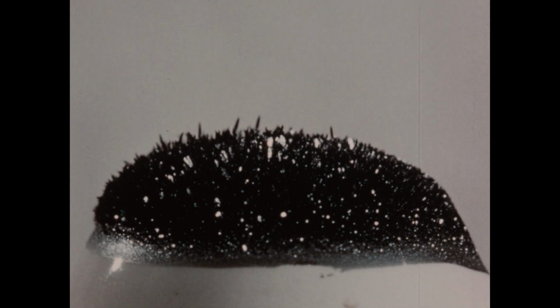When the reverse process happens, that is, when a solid changes directly to a gas without melting, it is, of course, called sublimation. And this is a useful method for the purification of iodine. We'll scrape some of these crystals from this dish and use them to test several chemical reactions of iodine.